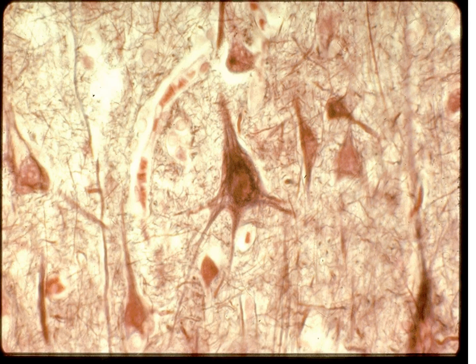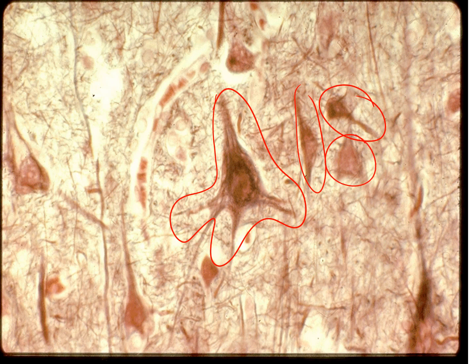Another great view here of some nervous tissue. This is a neuron shown right there, pieces of other ones over here. The other background stuff that you see here, of course, is neuroglia. That's a support set of cells that help to insulate and protect those neurons. Now, there's two major functions of nervous tissue. It is to provide irritability to sense stimuli, and also it can promote muscle contractions, or it can control effector organs. So we'll talk, like I said, again, more about nervous tissue later on when we get to that chapter in this course.